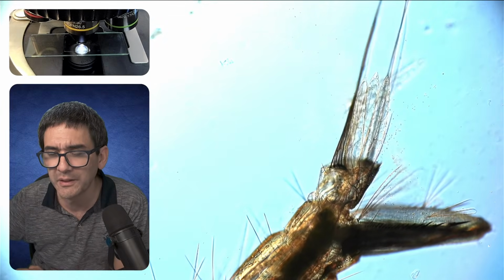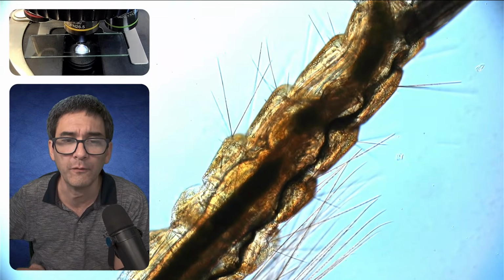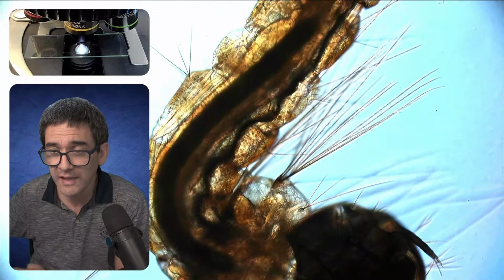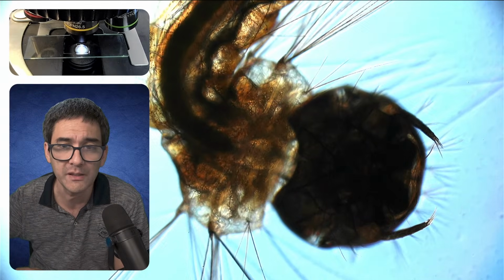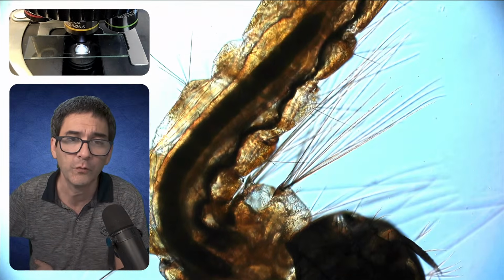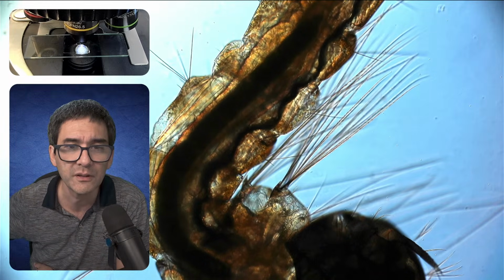I thought it was Diptera. Well, as a matter of fact, Diptera are those insects that only have one pair of fully developed wings, to which, of course, also the mosquitoes and the flies belong. So it is actually correct. Diptera, basically mosquitoes and related, and also flies belong to the Diptera. One fully developed pair of wings. Of course, we're looking here at the larvae. So it is, of course, a Diptera. This is how it looks.